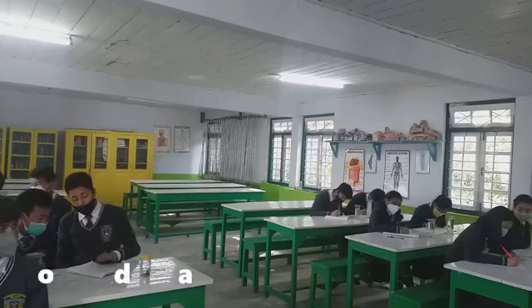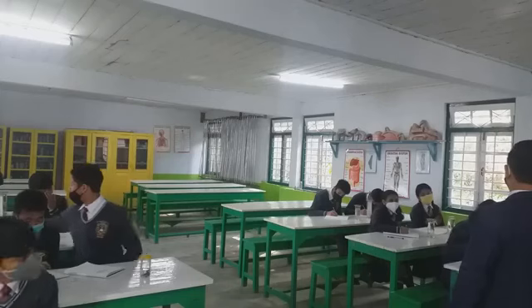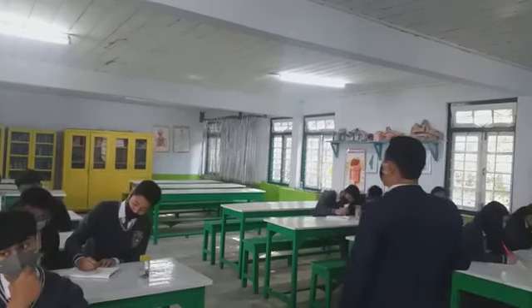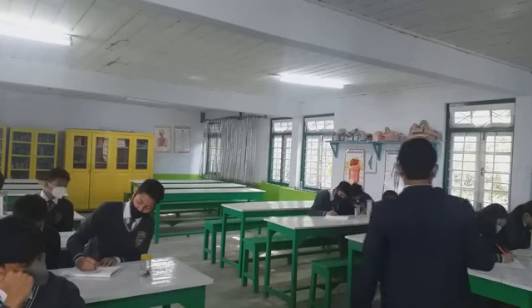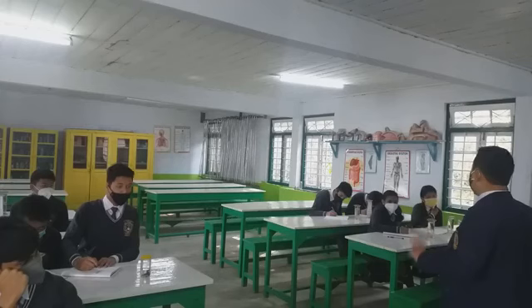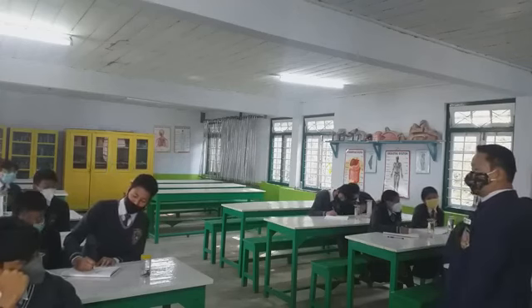So it belongs to Arthropoda. Listen, why is it Arthropoda? What are the characteristics of Arthropoda? The characteristics of Arthropoda mainly, see this one: they have got jointed legs. They have got jointed legs. As you see here, this cockroach has jointed legs.